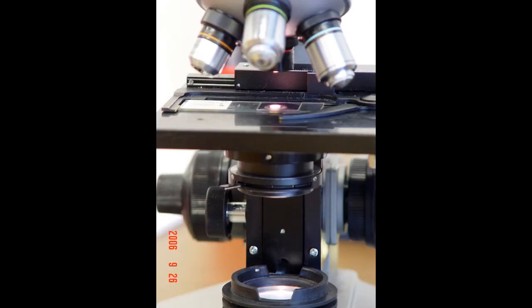A word about the condenser lens that's underneath the microscope stage. The condenser functions to collect and focus the light, and generally we want to have it in the fully upright position to take advantage of the optics in the microscope. There is an iris diaphragm on the condenser which acts like the f-stop rings on a camera, and it will let a little more or a little bit less light in depending on needs.